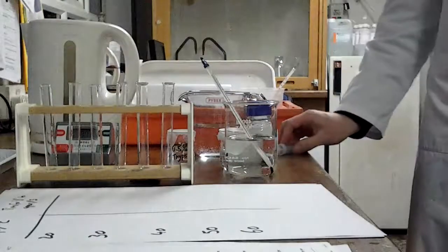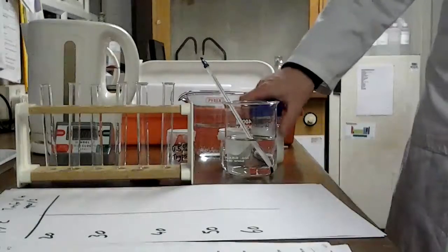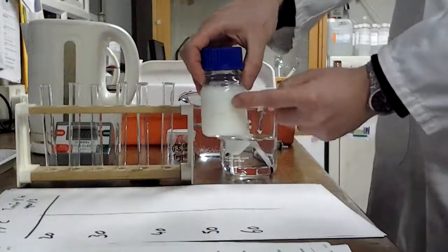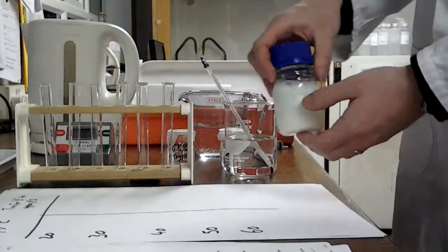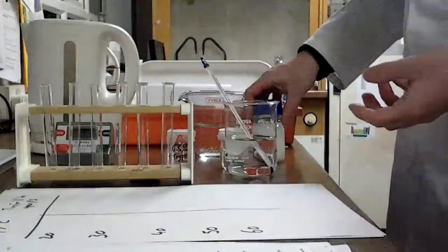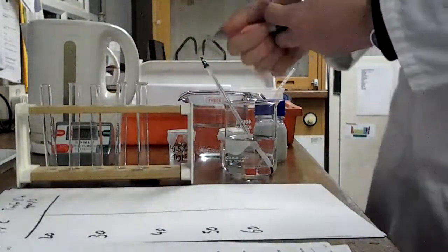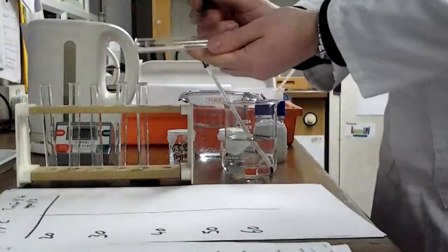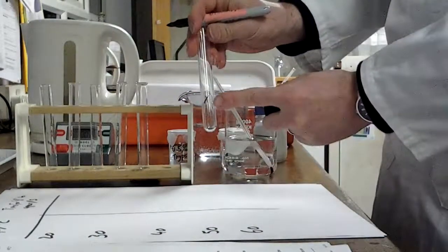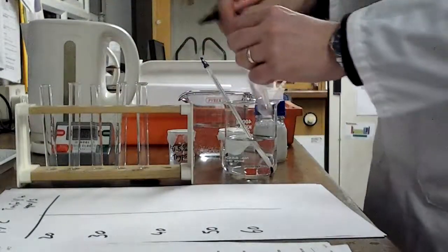Okay, now the way we know when the experiment has reached an end point, or when the enzyme's done its work, is that this liquid here, that is cloudy at the moment, will go clear. When you've broken down the protein, the casein in here, the liquid will stop being cloudy. And in order to detect that, what we're going to do is use the very sophisticated technique of putting an X on each test tube, and we're going to be looking through it, and when we can see that X, we would say that the experiment has run its course.